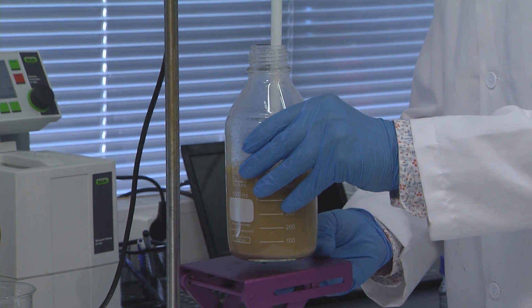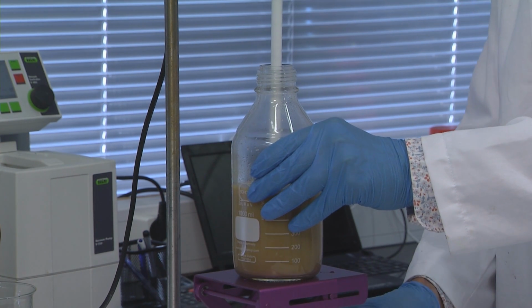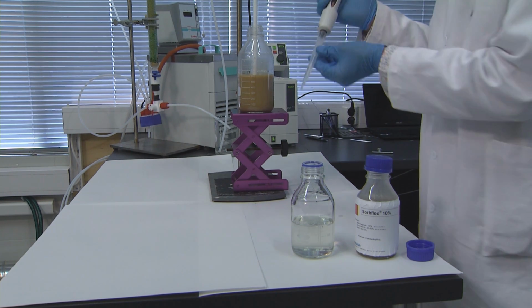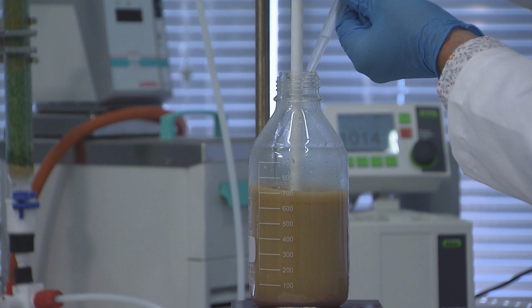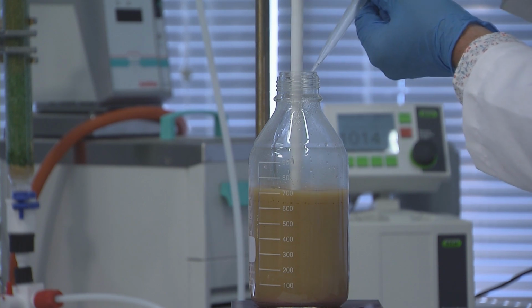Returning to our problem emulsion, here a small amount of diluted SORBFloc is being mixed with the wastewater, corresponding to a final dosage of 5 parts per million of active ingredient. In this step, the SORBFloc instantly associates with the surfaces of the oil droplets and any other particles in the water, although no change is visible to the naked eye just yet.